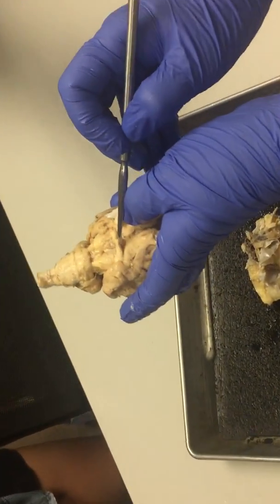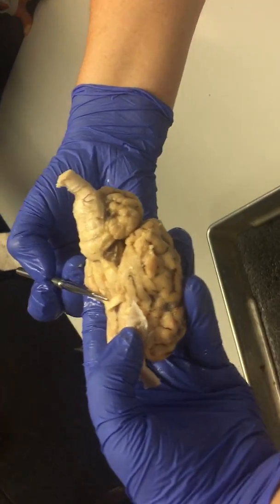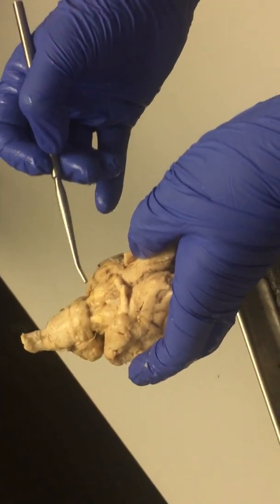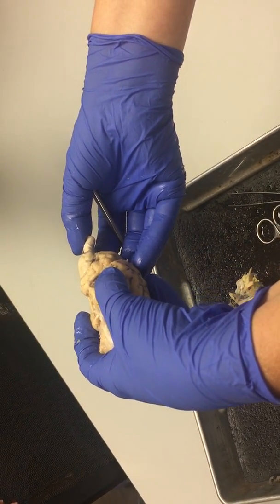This portion here — that is the optic chiasm, right there. So this is the center of the optic chiasm, and from here back it would be optic tract. A student asked: on the slides, the tract is represented by lines — is that just for representation? Yes, that's just for representation. If we dissect it out, it looks just like the optic nerve.